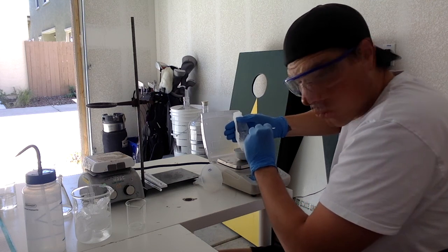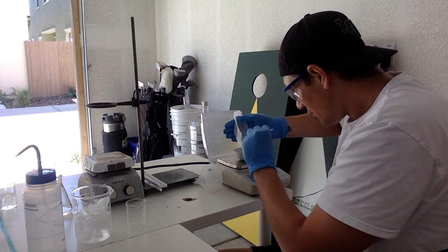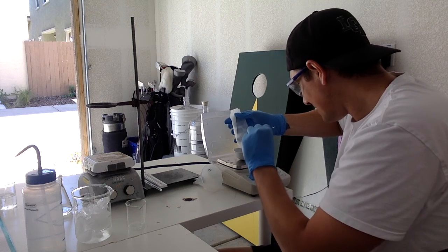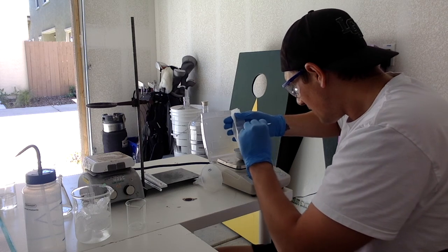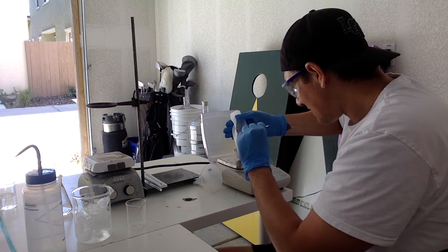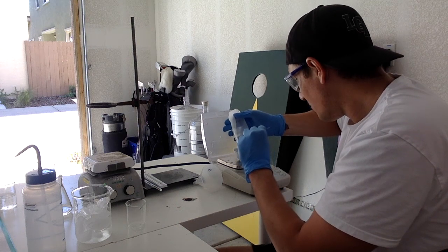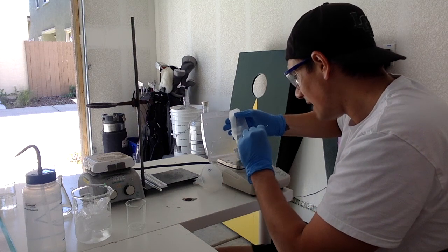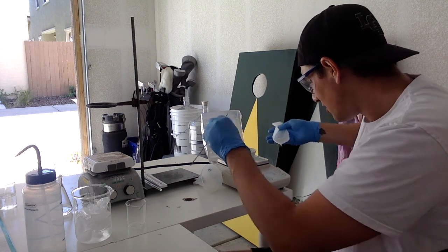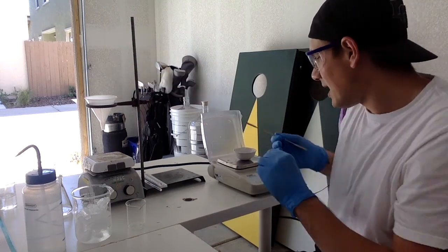So it's still kind of wet, but that's okay because what we're gonna do is, even though we're gonna get a mass here, I'm gonna get the filtrate out of there, and it's gonna be a rudimentary mass because I'm gonna recrystallize everything, get a brand new mass after it dries for a couple hours, all right? So first, let's just get all the crystals out of there. Looks like I got everything. Got all the crystals out.